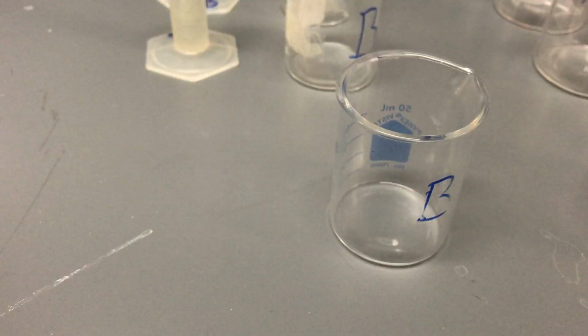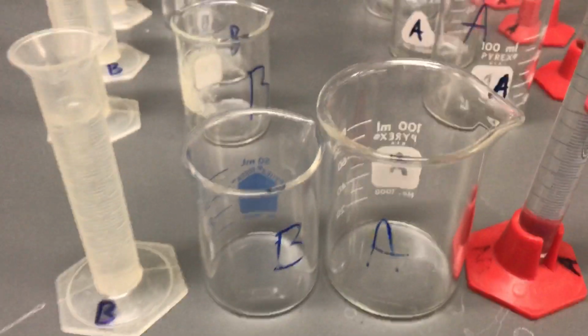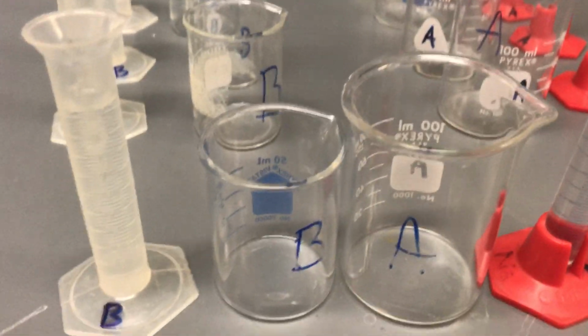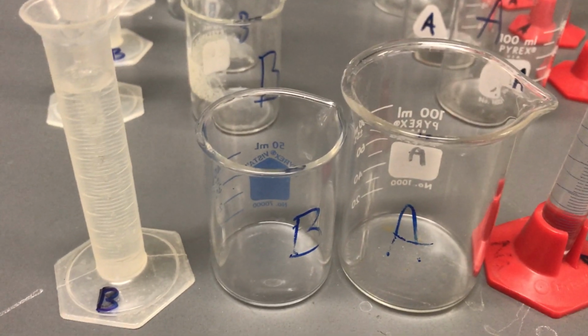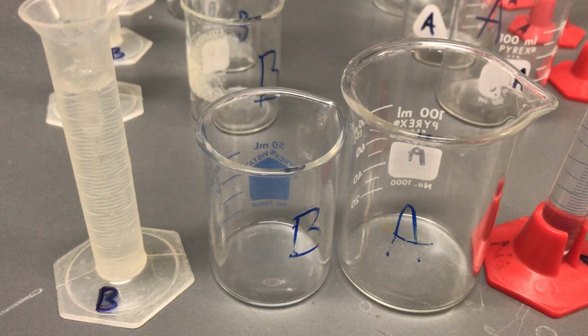So we're going to go in order from an equal value to another equal value. So we're going to go from 10 and 10, and then we'll go 10 to 8, 10 to 6, 10 to 4, 10 to 2. And again, each of those will also have an equivalent 10 milliliters, but I have to add extra water into them. So for example, the first one is already set, but the second one I have to add 2 milliliters of water into. Then I'm going to add 4 milliliters into the next one, so that adds up, 6 plus 4 equals 10, so on and so forth.